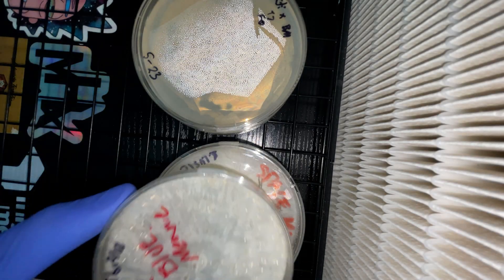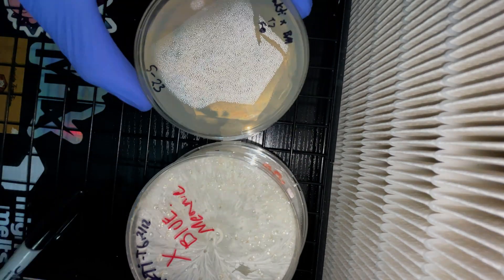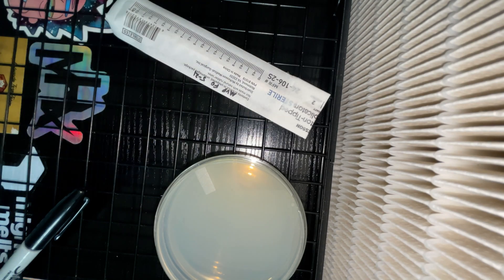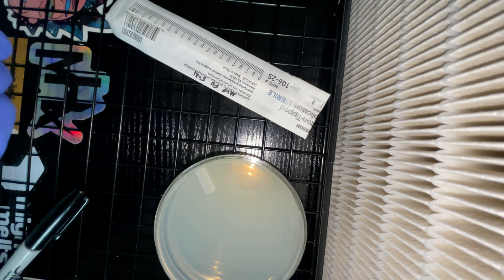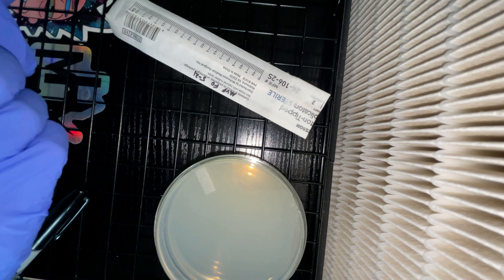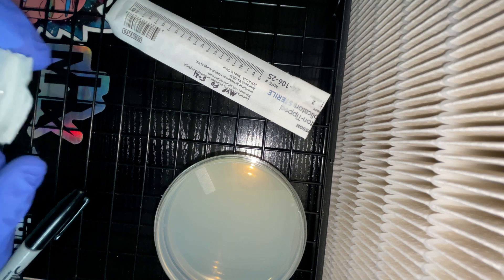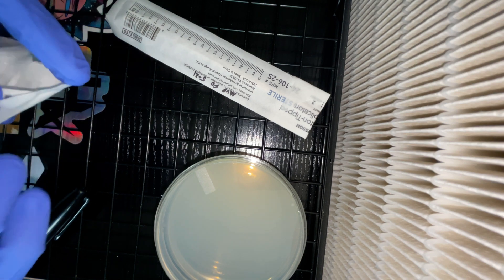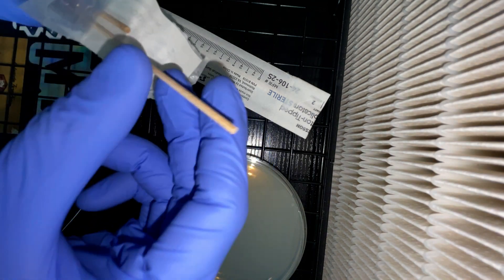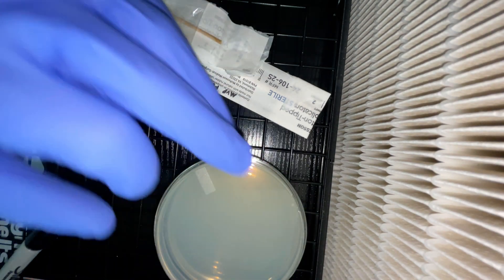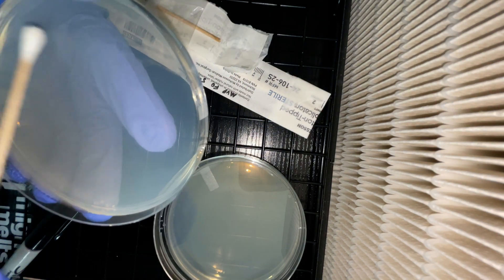Everything you see here will eventually make its way into a 32-quart sterilite gasketed bin and tested. Only the fruit that looked the best in my opinion will be kept until I have a full lineup of strains and mutations that I absolutely love to cultivate. You'll never know if you love something until you try it. Besides that, we have some swabs here to test. This is some of my first swabs that I have ever done in front of this flow hood and I can't wait to see how these germinate as I can test the efficiency of how well this hood works.